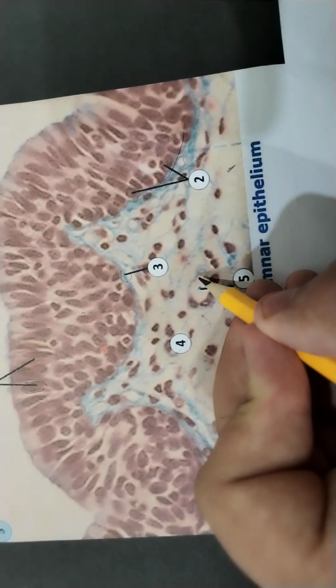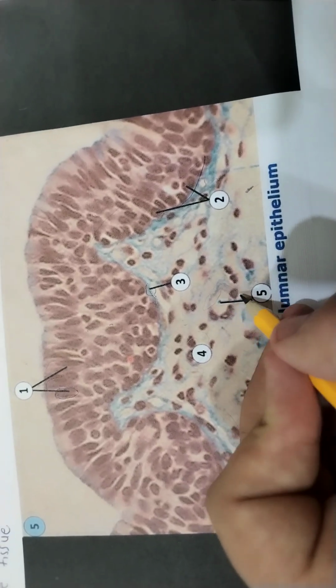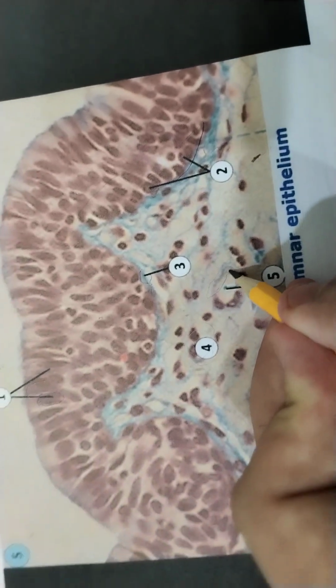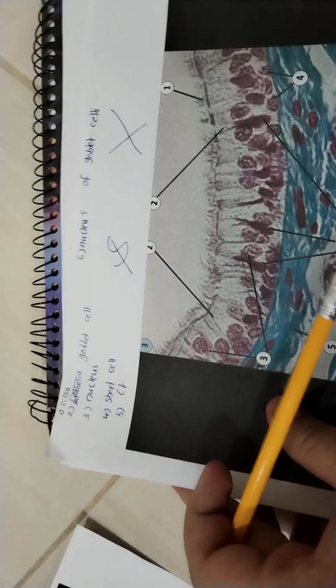If we come and see, blood vessels appear just like red, okay? They take the eosin stain, and they are lined by squamous epithelium, okay? Simple squamous epithelium. It's called blood vessels. So the next slide, we have another type of epithelium.